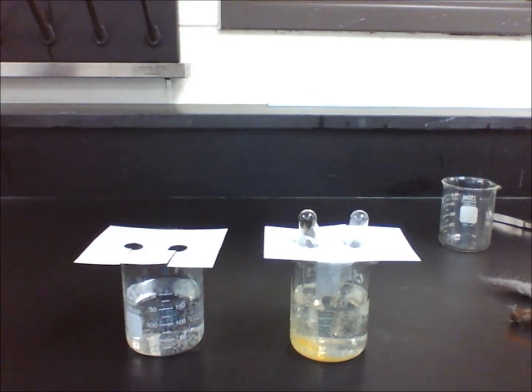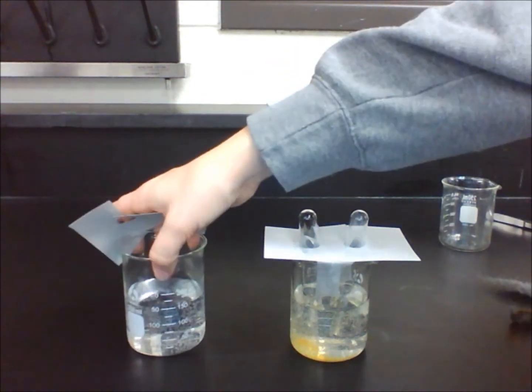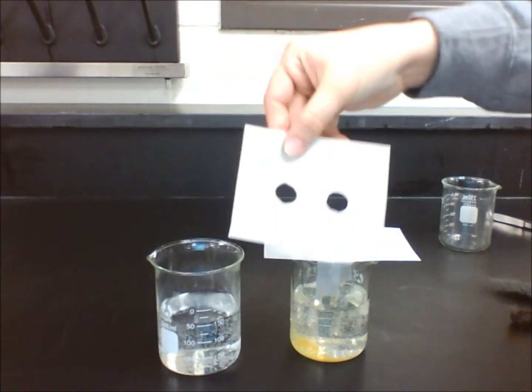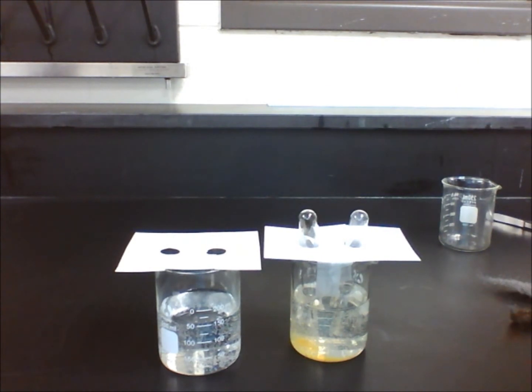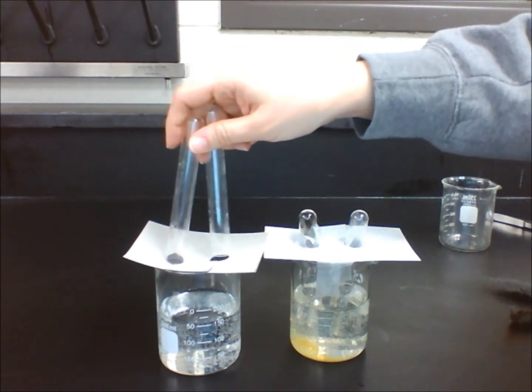Students then put 150 milliliters of water into a beaker. Cut out an index card so two test tubes fit with the card holding them in place. We have taped it to the beaker to ensure it stays.